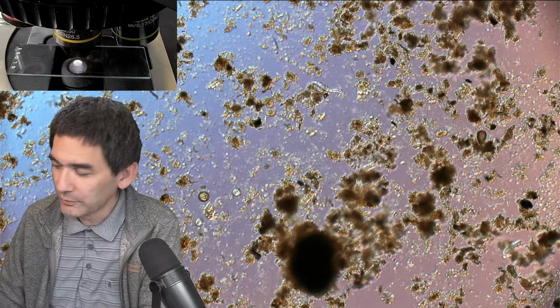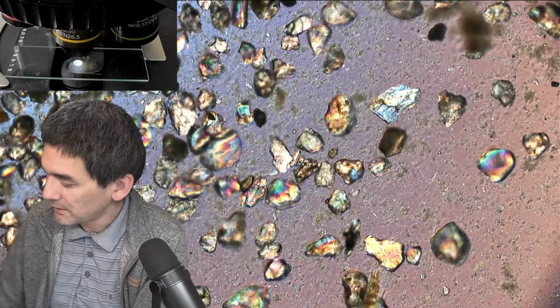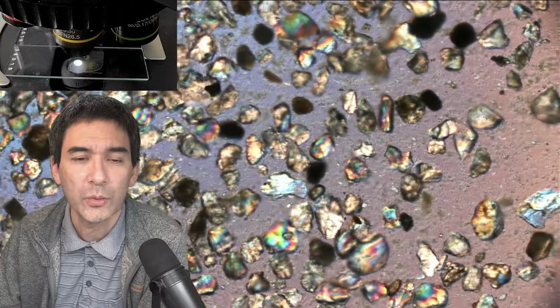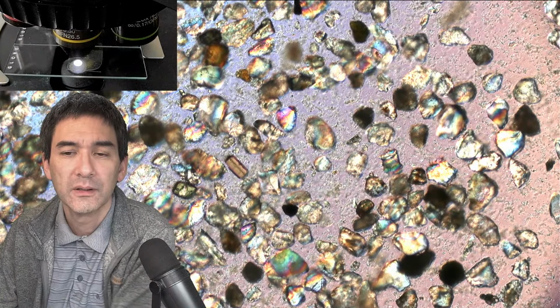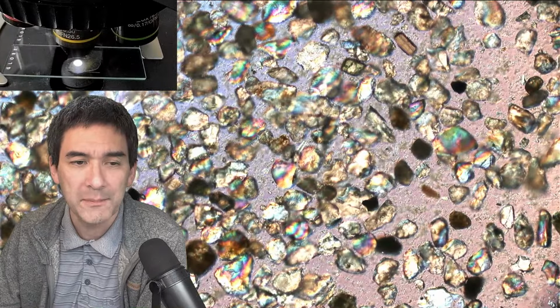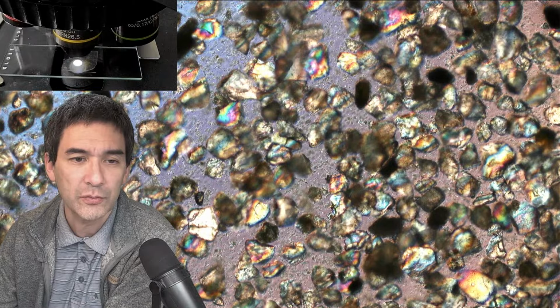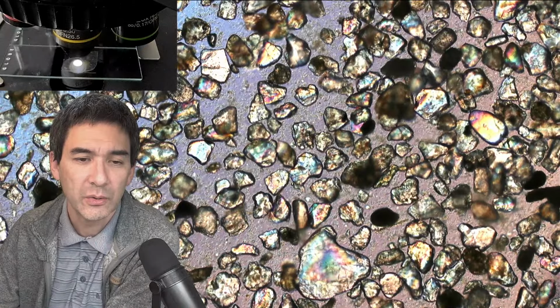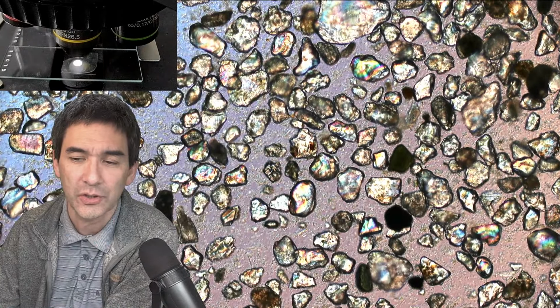Oh yeah, so it's still the one from before. I'm just going to add the slide here, and now we're going to look at this marine water. As expected, there's not so much movement going on, but if we observe carefully, occasionally we are able to see some diatoms. And if I were to now do a time lapse, then sometimes when you speed up the video, you're able to see some of the sand grains moving, because some of the diatoms actually start pulling on it. So still 2.5 years ago, this was a very active culture.